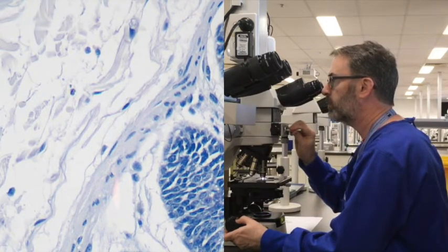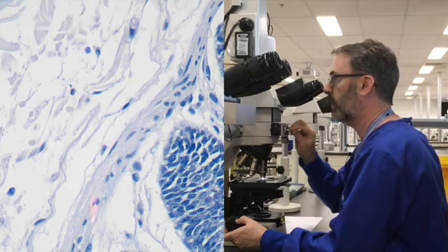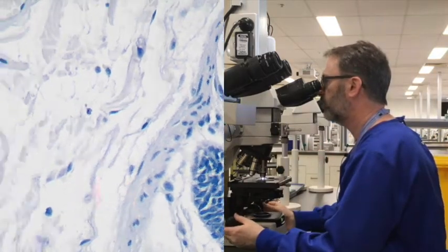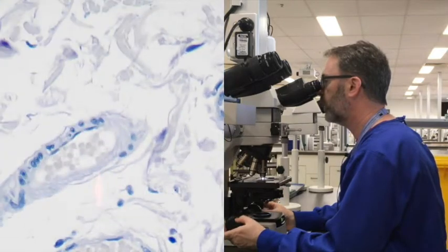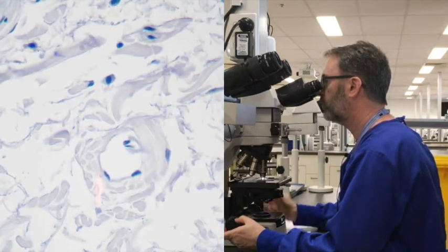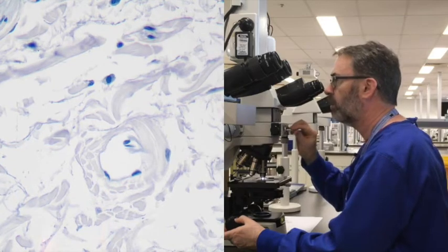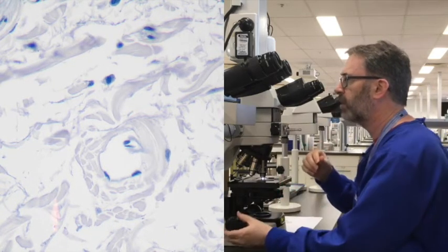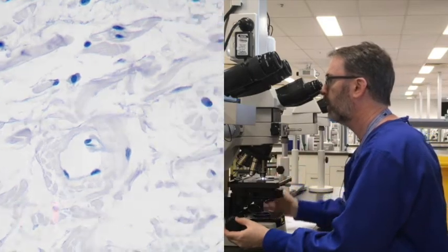If we look at this band of smooth muscle, the muscularis mucosae, beneath the mucosal epithelium, see that that clearly also has a kind of a blue-grey colour, so it's still quite heavily stained. And if we go out into the connective tissue where we've got some arterioles and collagen, you can see the collagen itself has quite a grey or slightly blue colour to it.